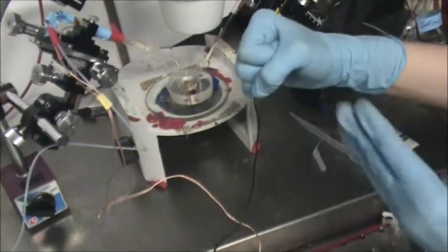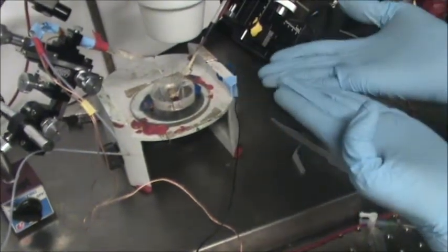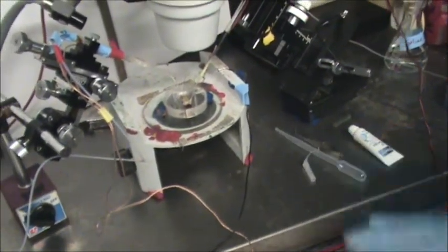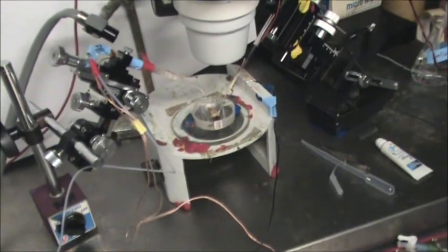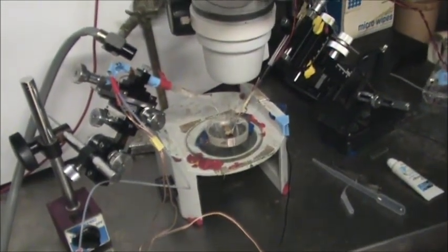And if this is the sixth ganglion, you'll want to cut far away from it so that we have plenty of space to suck up into the electrode for stimulation. This electrical stimulation will be a better and more standard stimulation than the air pulse we were using before, and will be forced up the nerve into the connective nerves that we'll be recording from.